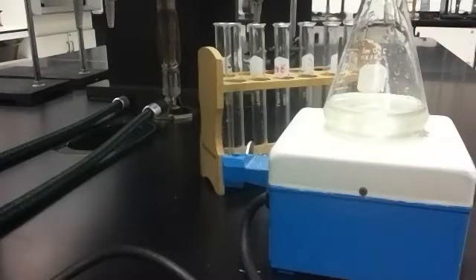Well, every time I add a test tube, if you flip over to page 170 at the top there, equation 6, they show you how iodine reacts with that ion to turn iodine back into an ion. So what you're going to see is iodine is going to be going back and forth from having a charge to not having a charge. When you have iodine, not iodide, but iodine, then it will complex with starch. So we're going to see a bunch of different color changes.